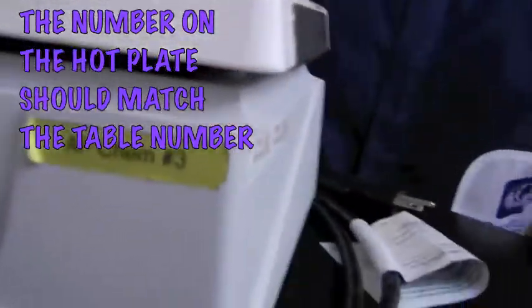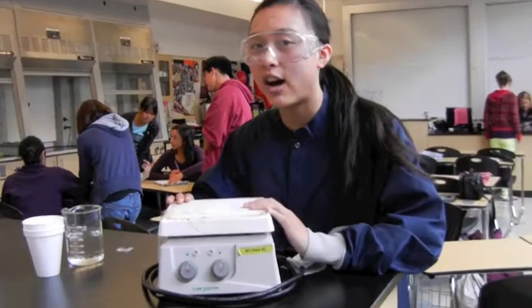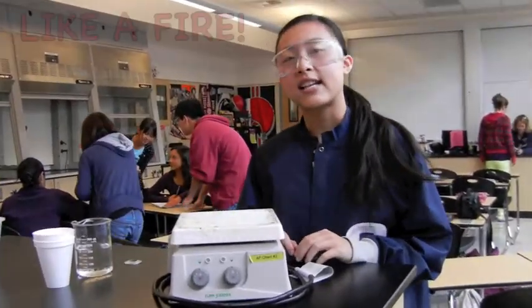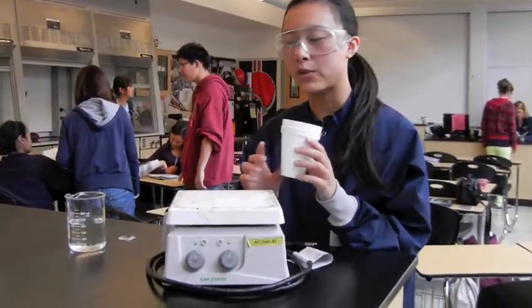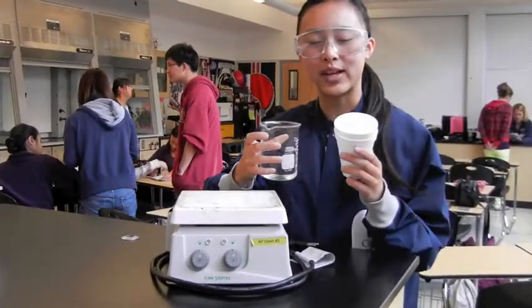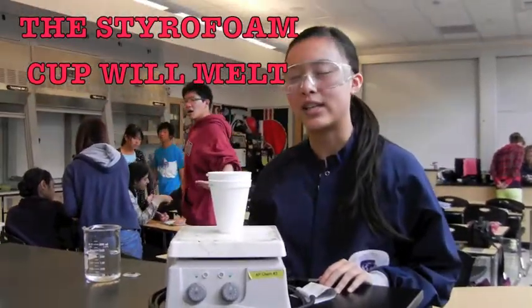A few notes about the hot plate. When you are not using the hot plate, make sure you unplug it, because if you don't, nasty accidents can happen. Also, don't heat the styrofoam cup. If you want heated water, heat it first in the beaker and then pour it into the cup, because, well, you know, bad things happen when you heat styrofoam.